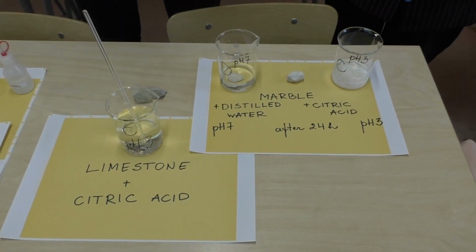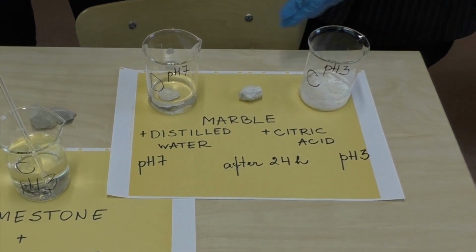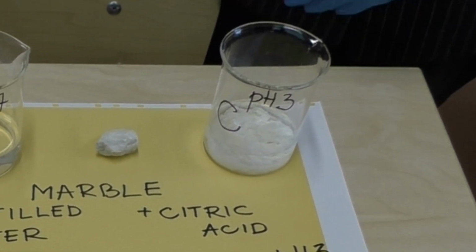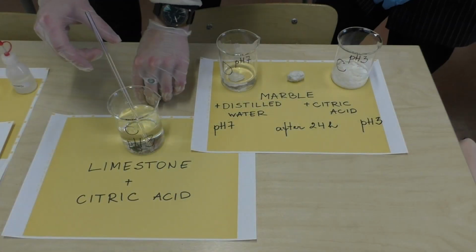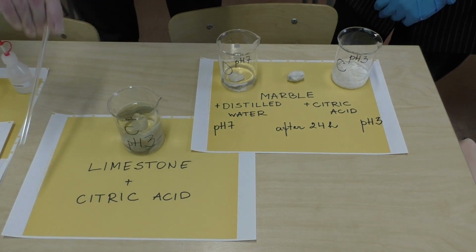With this experiment, we started 24 hours ago. We put a piece of marble in distilled water and in citric acid. The one in the distilled water hasn't changed at all, but the one in the citric acid has decomposed almost completely. And now we're going to be putting a piece of limestone in citric acid solution and let's see what happens.